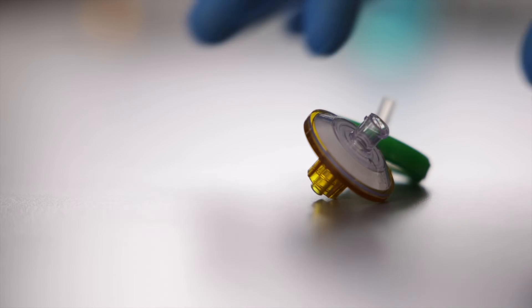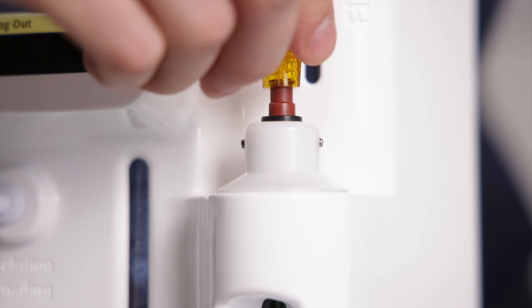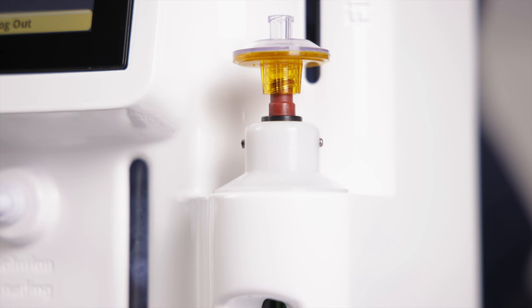The unit will then prime the circuit so that no air is being forced into the filter. Here, the user is prompted to install their filter for testing. The circuit closes and it begins the wetting process. If more wetting solution is required, now it may be loaded.